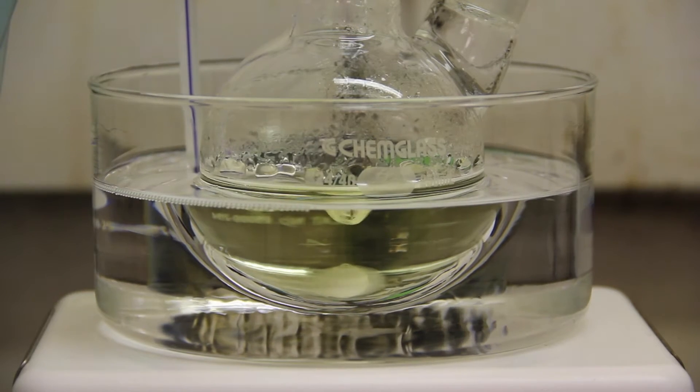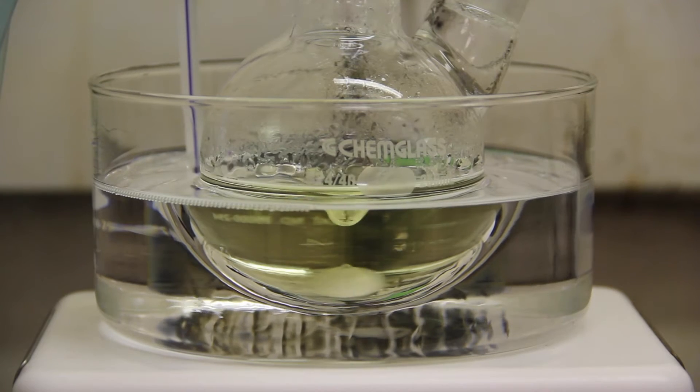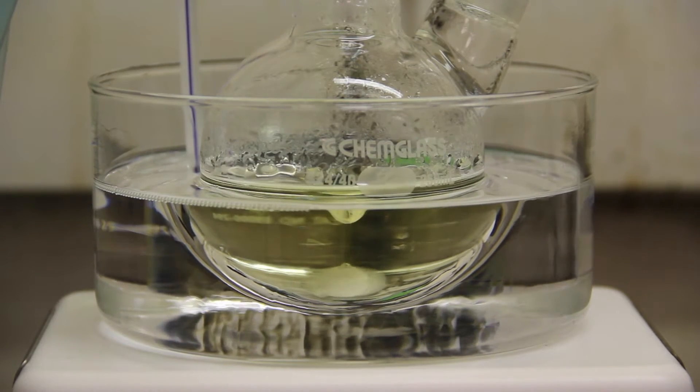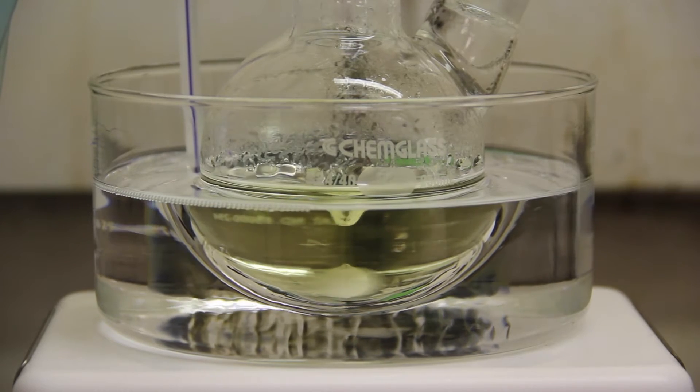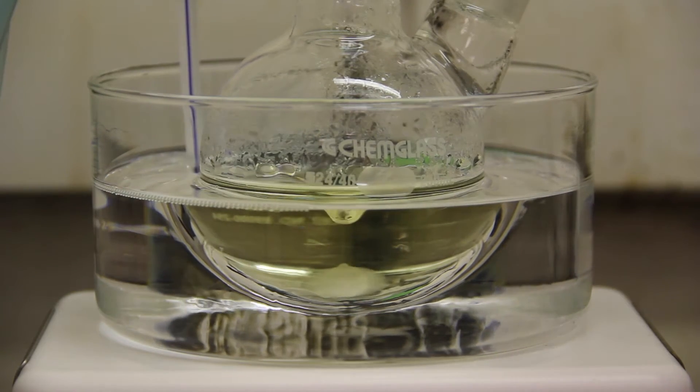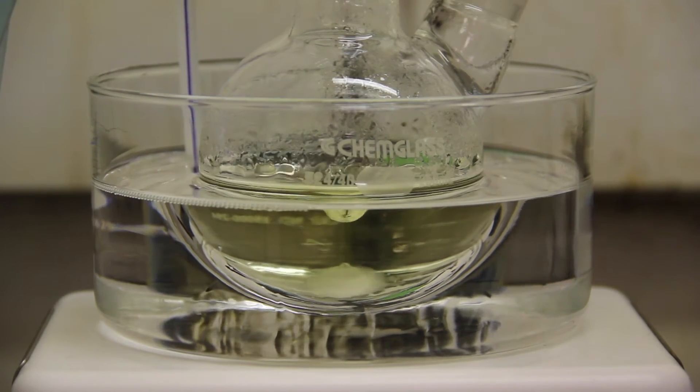This way we don't lose any volume of water and all of the concentrations of our reactants stay consistent throughout the reaction. Now since we're at our target temperature we're going to add our reducing agent which is also our stabilizer.